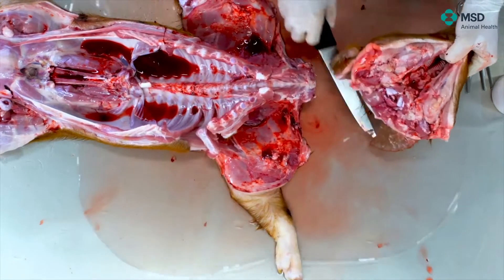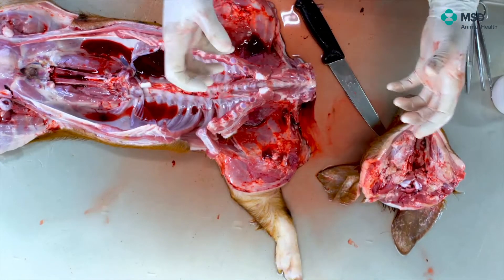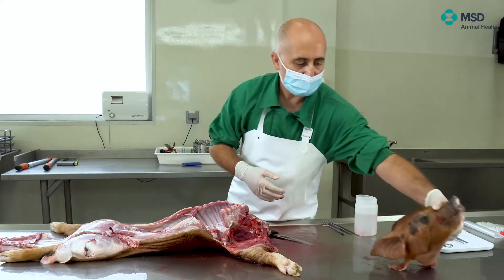Of course, the bigger the animal, the more difficult it is. And sometimes, if you have a kind of surface on which you make the corresponding force on both sides for separating, much better. Here we have the head, and we will study it afterwards.